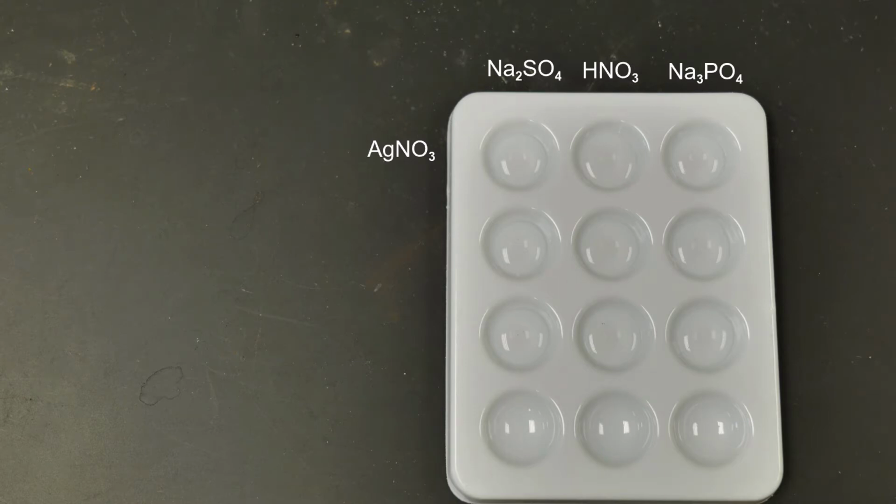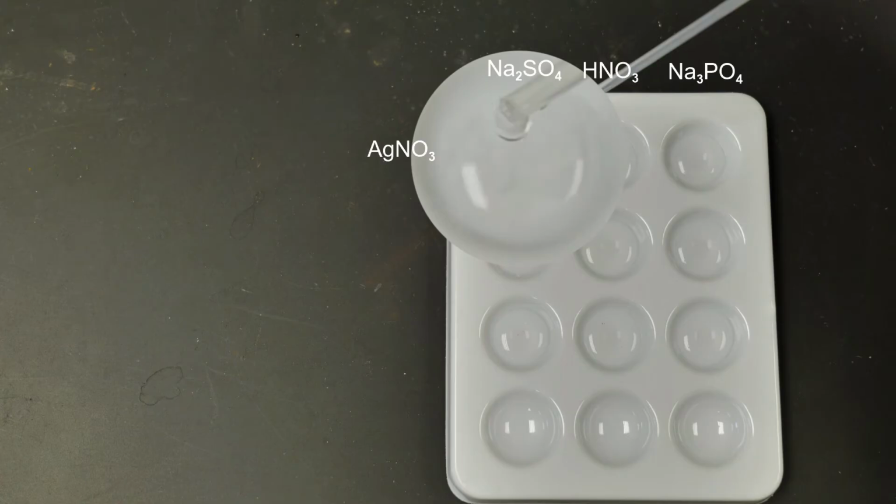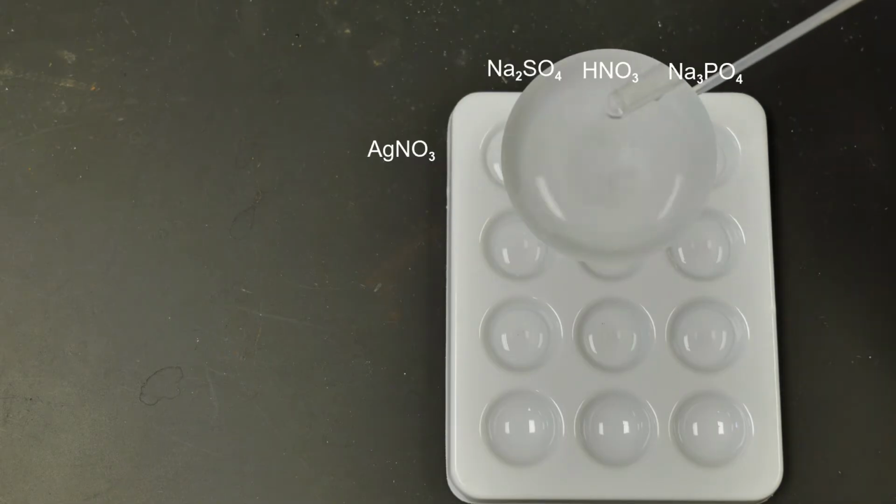For our first reaction here, we're going to add some silver nitrate into the top row with the sodium sulfate, nitric acid, and sodium phosphate. So here we go. First off, we have the silver nitrate and sodium sulfate. Do we have any observations we can make? Do we see any change occurring? I definitely see something.